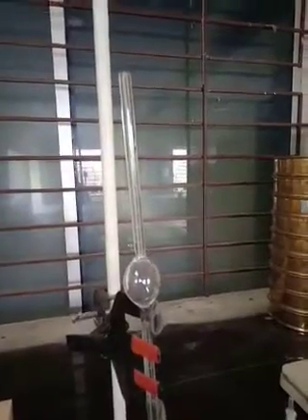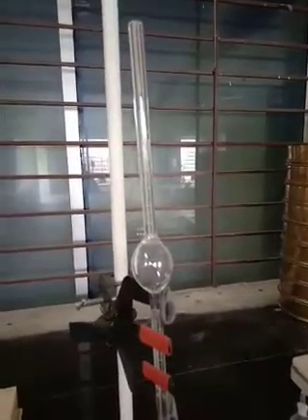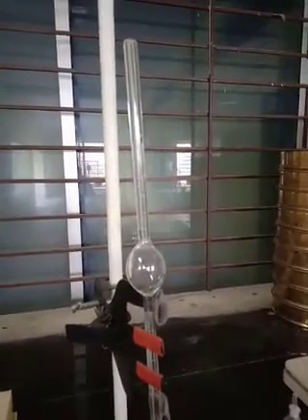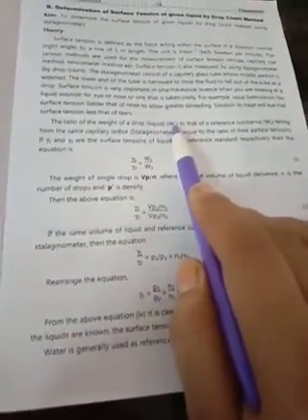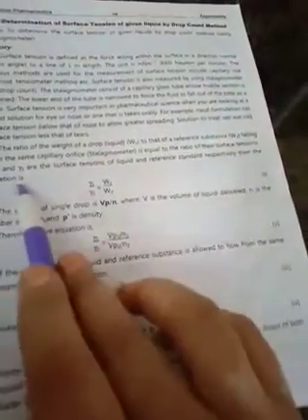The ratio of the weight of a drop of liquid to that of a reference substance falling from the same stalagmometer is equal to the ratio of their surface tensions. We compare our unknown liquid sample with a reference. The weight of the drops is W1 for the test liquid and W2 for the reference, and surface tensions are γ1 and γ2 respectively.